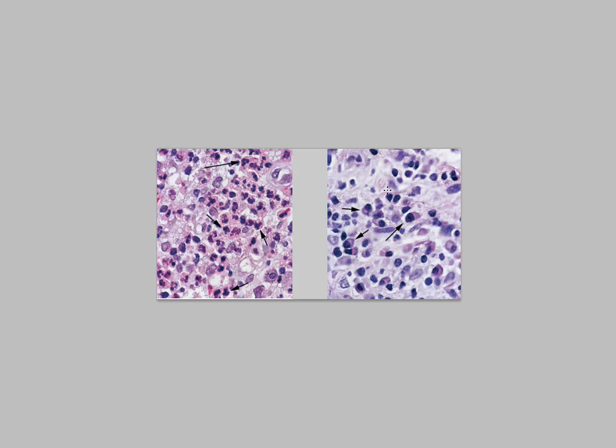We know about the differences in time course and in etiology, but the most important difference in terms of identifying them is the cells that these types of inflammation invoke and bring into the tissue. The only definitive way to tell them apart is by locating the inflammatory cells and then identifying their nuclear outline. There are always going to be white blood cells, but they're going to be neutrophils in the acute inflammation and mononuclear cells in the chronic inflammation.